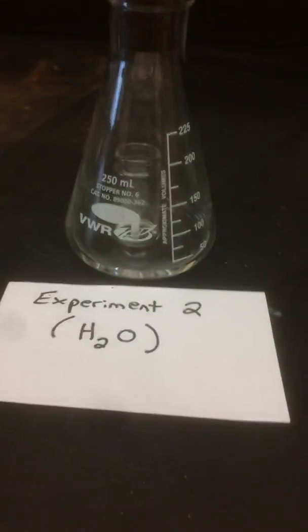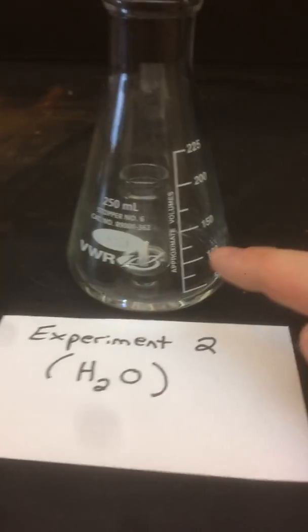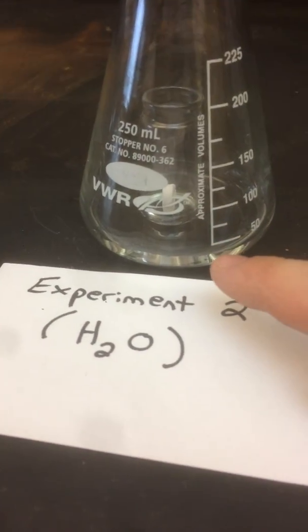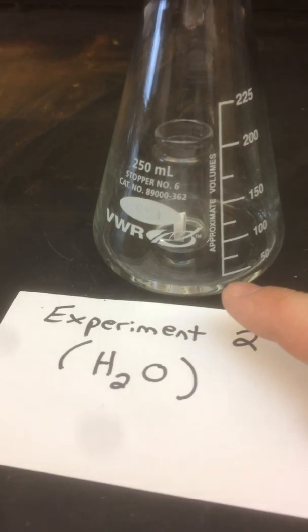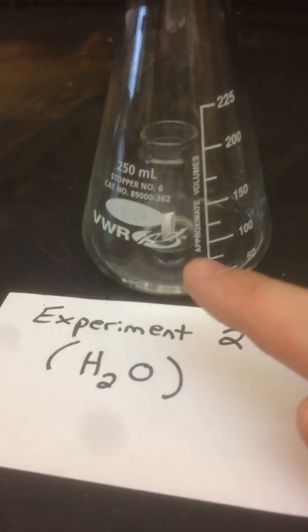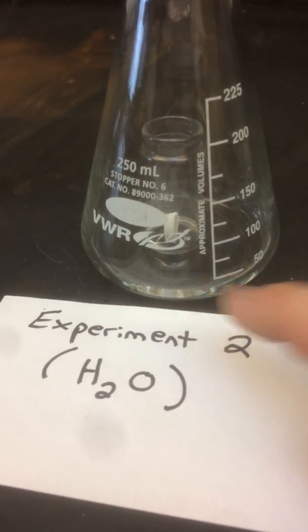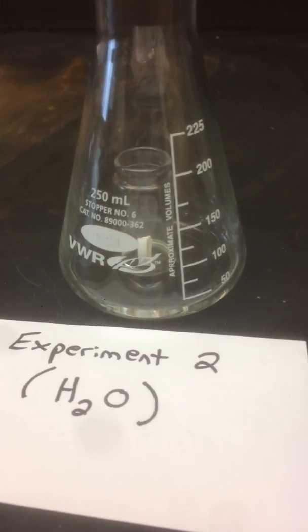The second experiment here, so I have another setup, has got, in this reaction flask, I still have an Alka-Seltzer tablet, but now all I've got is water. So what's going to happen is the acids in the tablet are just going to react with the sodium bicarbonate. There's no excess acid in this case. It's the acids in the tablet that are the limiting reactants.